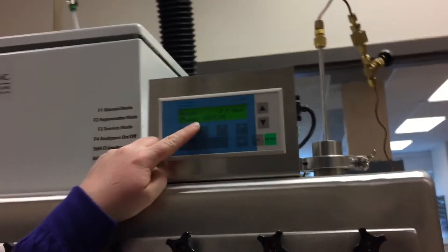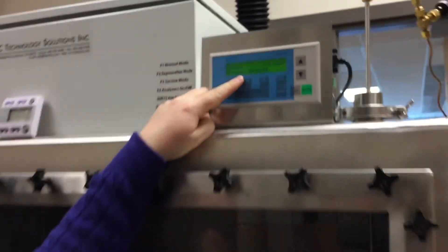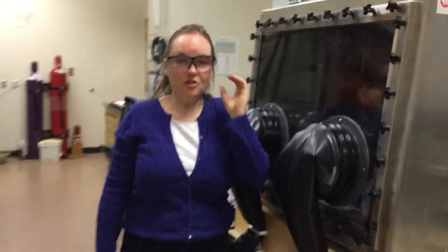It just goes through the first phase where it says heating. There are four phases involved. After this is purging. And the next phase is evacuation. And followed by cooling as the final phase.